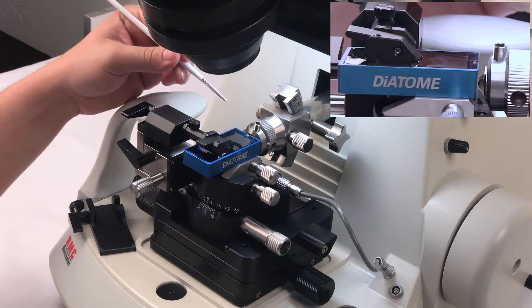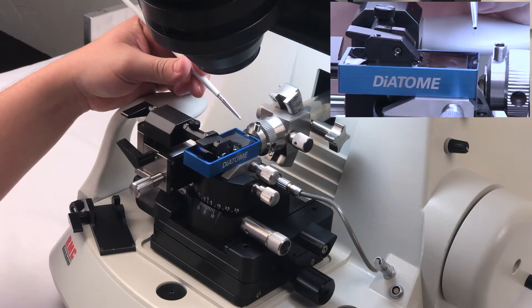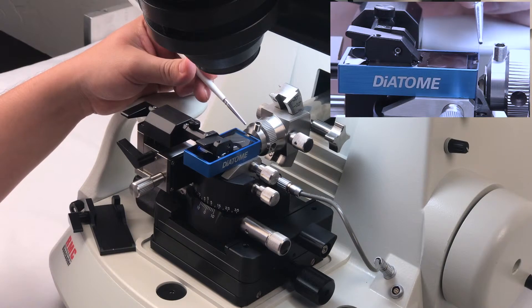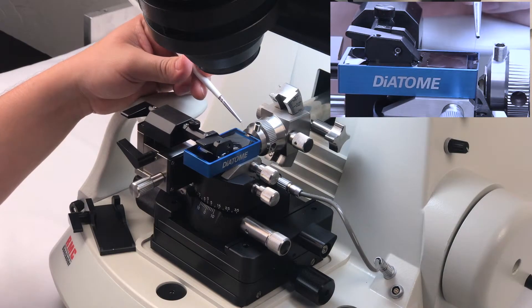Okay, now we're gonna break off the ribbon from the knife edge. My technique is simply to touch the knife, the section on the knife edge, until it breaks off like so.